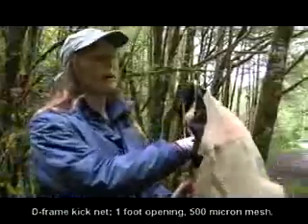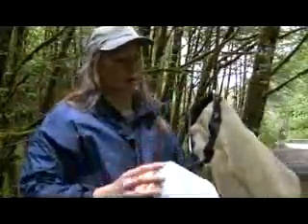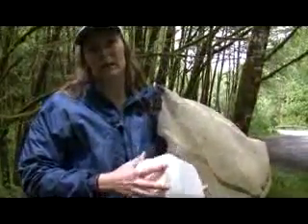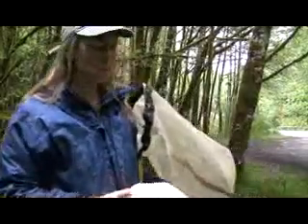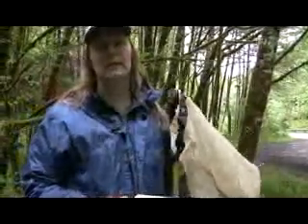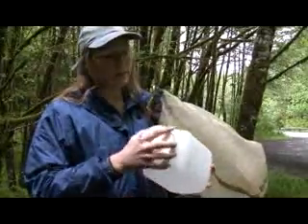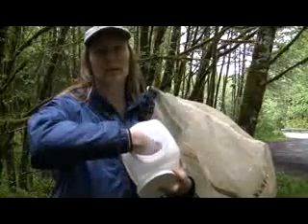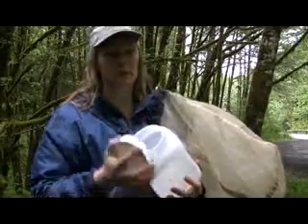This is a pretty standard mesh size. It's used by a lot of different agencies, both state and federal. And the standardization of that mesh size helps to make your data comparable not only within your program, but with other agencies. In addition to this kick net, you also need a wide mouth jar. One of the reasons that we use wide mouth jars is because it's easier to get your hand into and get your sample in there. If you have a narrow mouth jar, it's really hard to get everything in there.